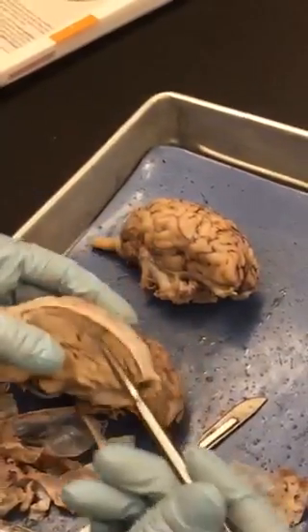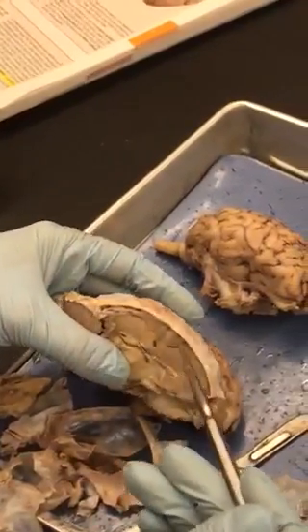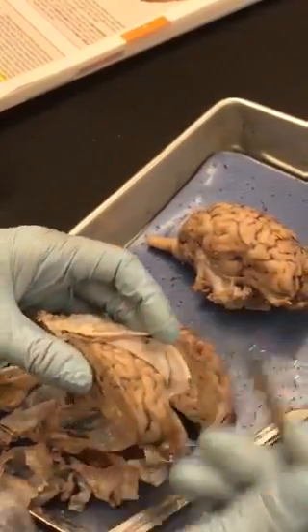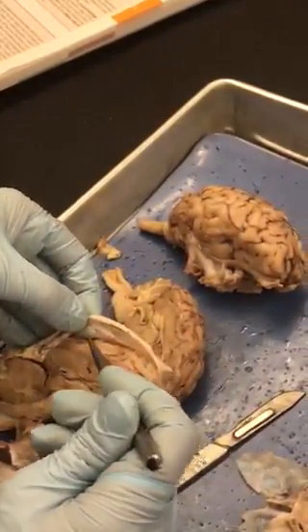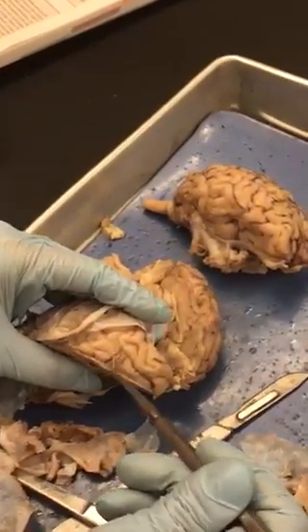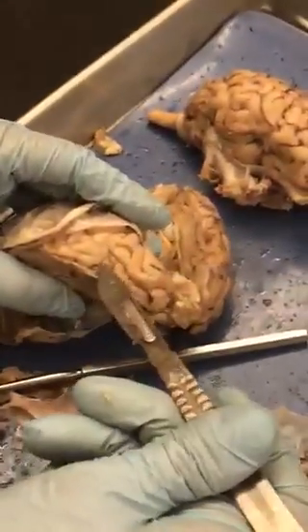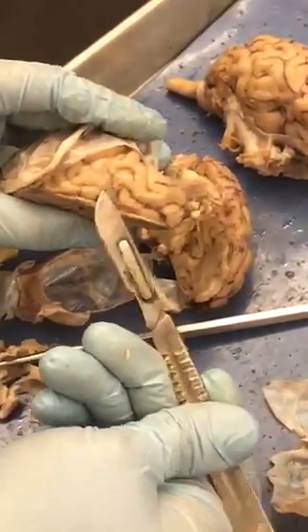Okay, and then lastly, your meninges. The tough one on the top is called the dura mater. Underneath is the arachnoid mater, which the cobweb-like structures have been removed. And then adhered like cellophane right on top of the brain is the pia mater. It's a very clear cellophane-like structure right there. And that's it.